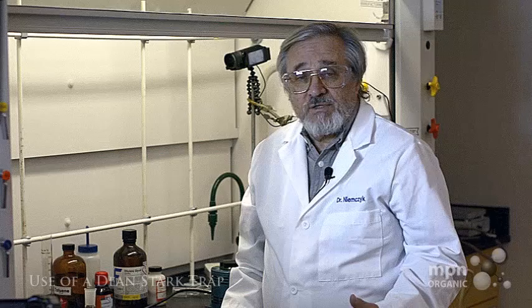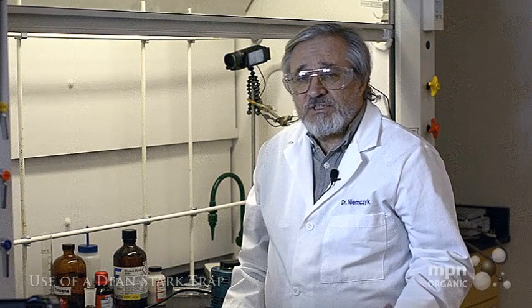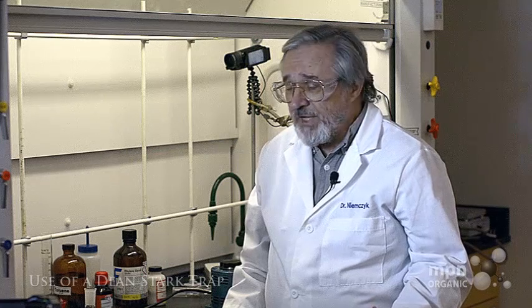Today we're going to look at a technique that's very common in the organic chemistry synthetic lab but undergraduates rarely get to see, and that is the separation of water during a chemical reaction.